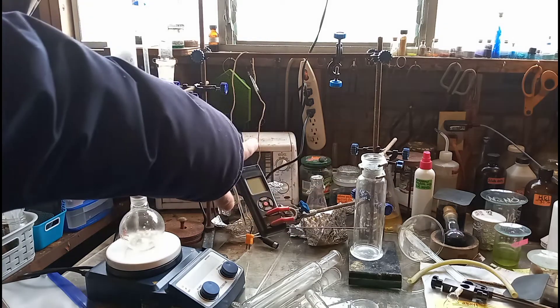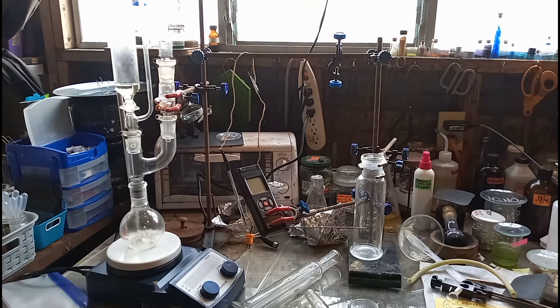The reason I don't have the wash bottle hooked up yet is because off camera right now, I'm actually stirring up the solution of potassium ferrocyanide trihydrate in some water. Just as a side note, everything in my lab right now that's just water is frozen solid, so I did not use distilled water for this — I'm only using tap water. There's a color change that's going to occur, and if it looks a little different from what you see me do, that's just because of stray cations like magnesium, calcium, and whatever else might be in tap water.